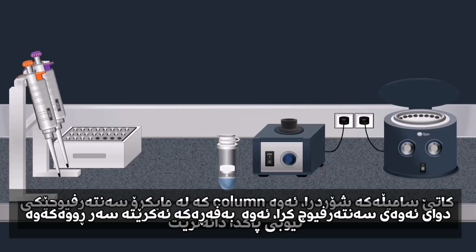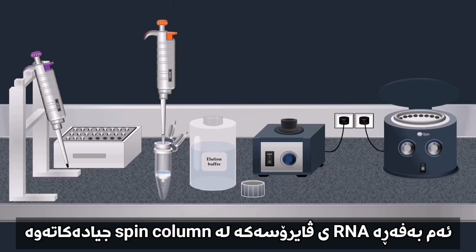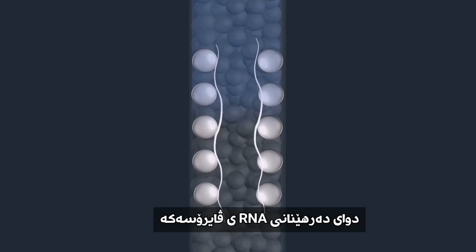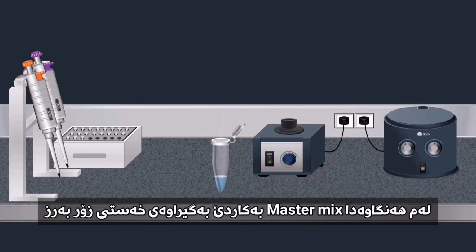Once the sample is washed, the column is placed in a clean microcentrifuge tube and an elution buffer is added. Then, centrifugation is carried out, forcing the elution buffer through the membrane. The elution buffer removes the viral RNA from the spin column. And a purified RNA, which is free of protein, inhibitors, and other contaminants, is obtained.